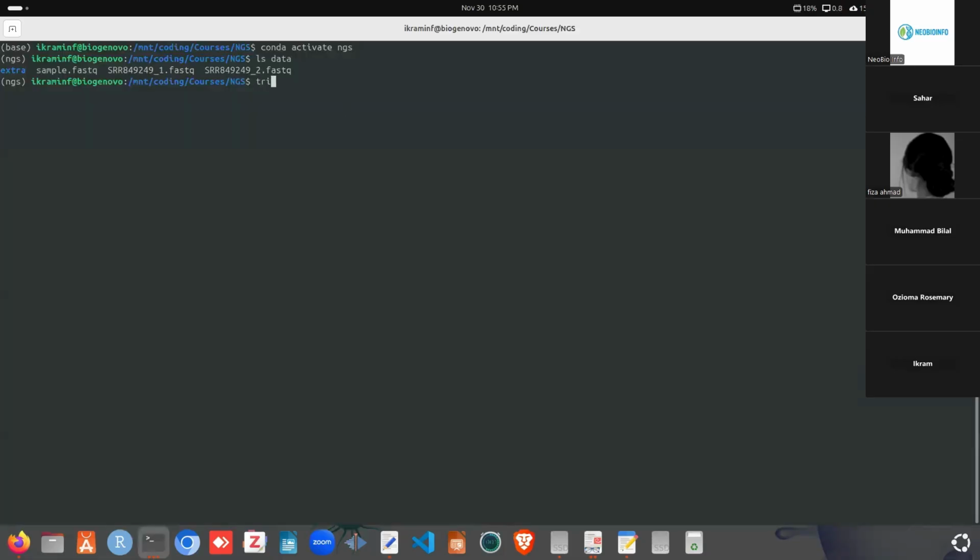So first we will work with the LEADING and TRAILING commands. This is the tool name, Trimmomatic, and we are running it on a single-end file, and we need to specify the quality encoding. We are using phred33. Then we need to specify our input FastQ file name, that is sample.fastq. Then the output file name, which should be inside the data directory, in the trim directory, and we can specify the output file name as sample_trim.fastq. I'm just writing this, that is LEADING:3. Let's calculate what it will do manually first, then we will check the output by running the tool.